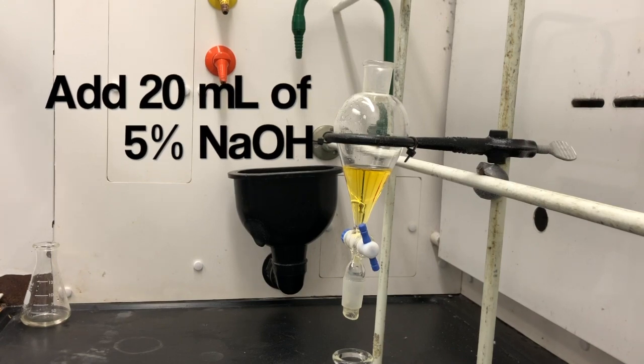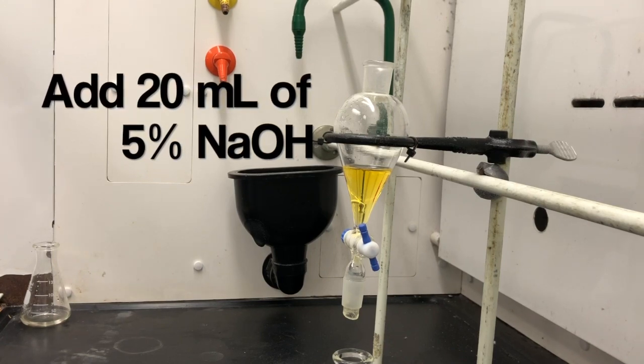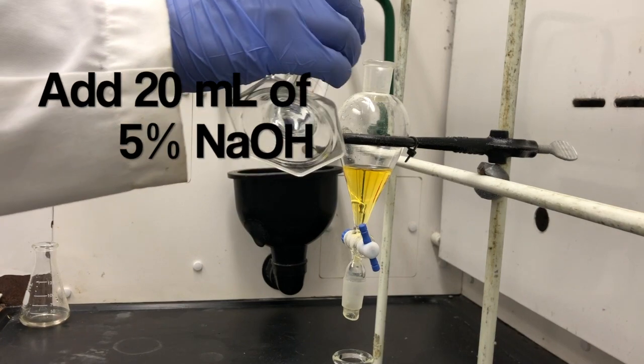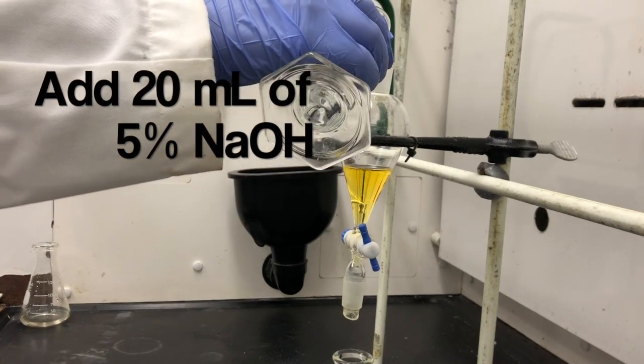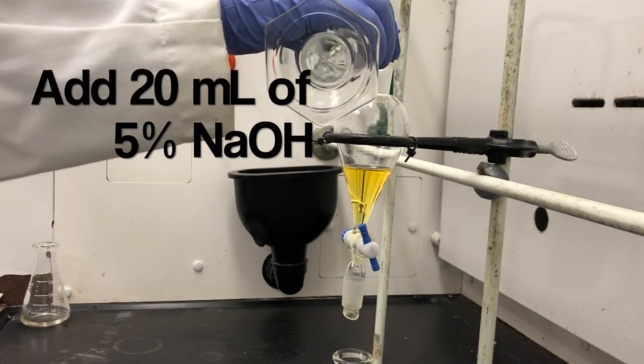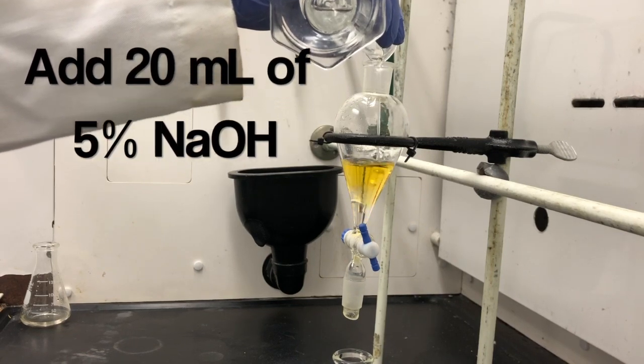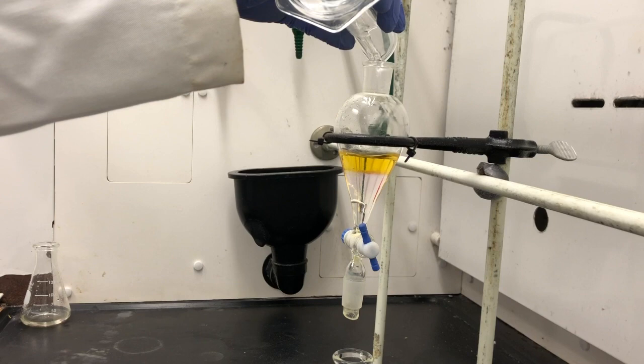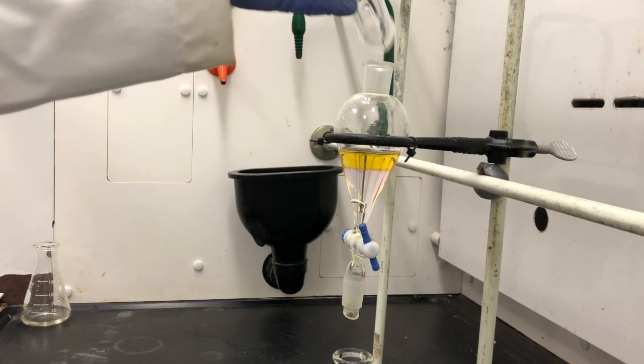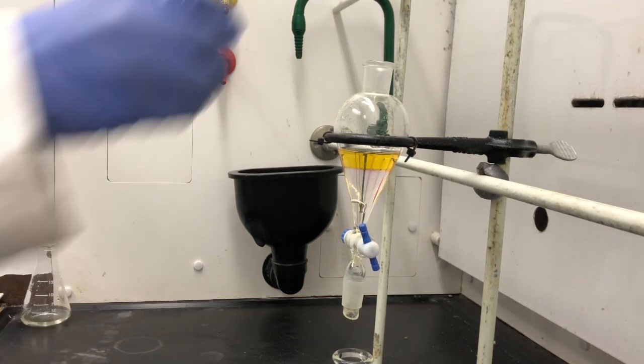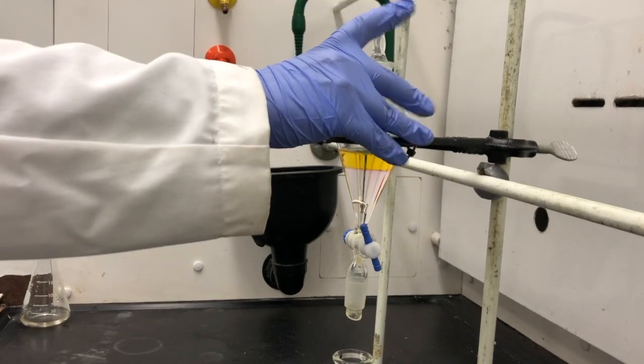All right, so next we're going to add our base, and then we're going to repeat the process of mixing and venting.